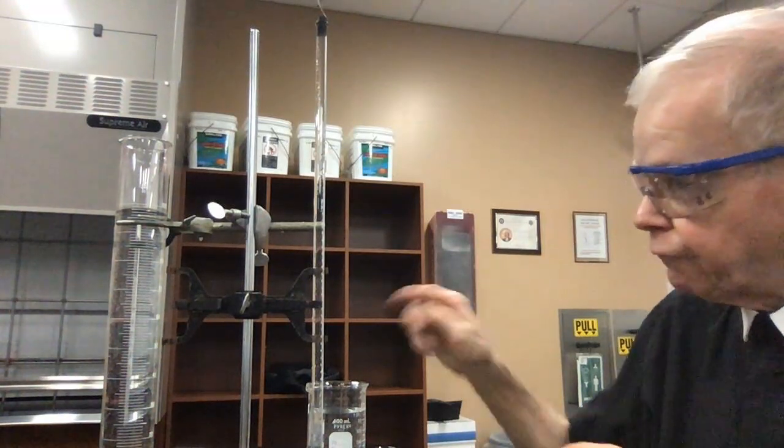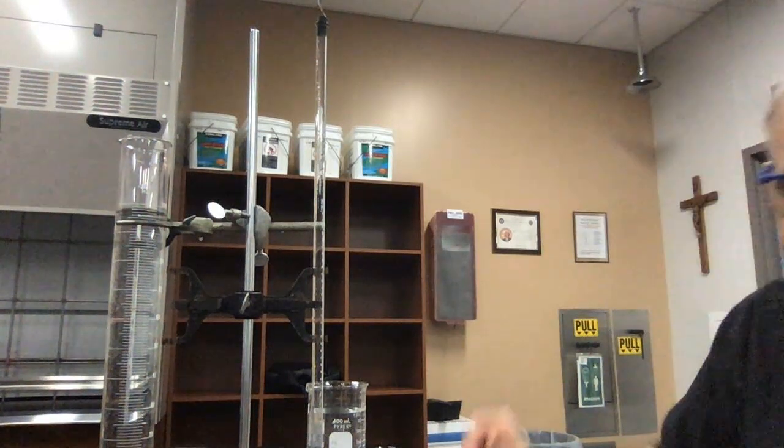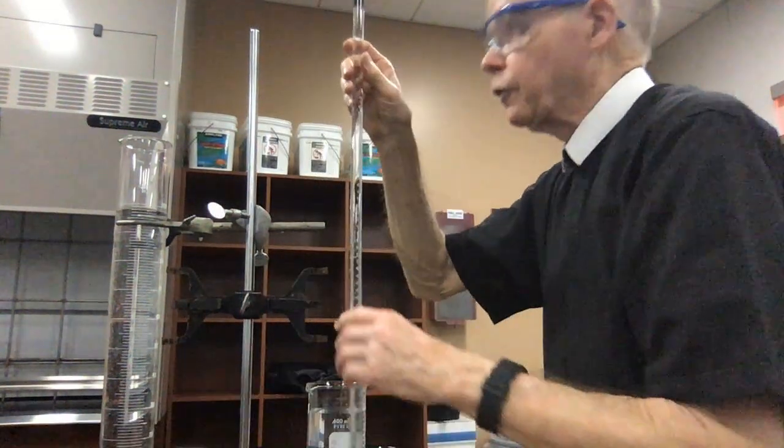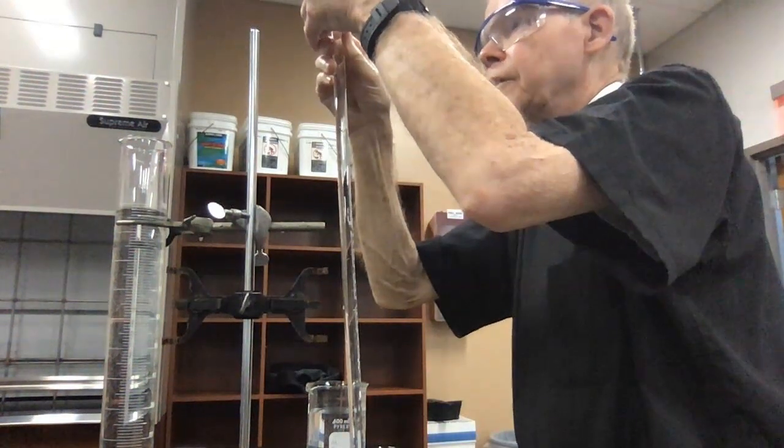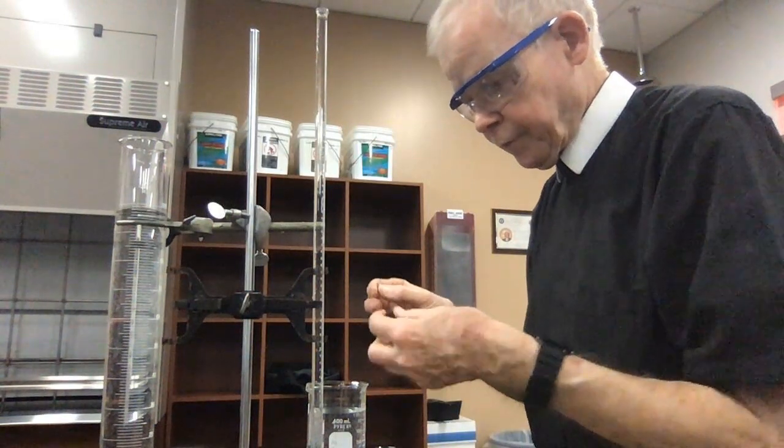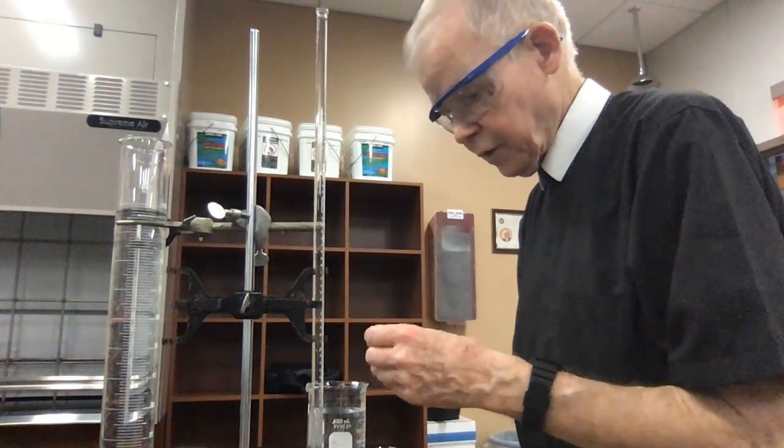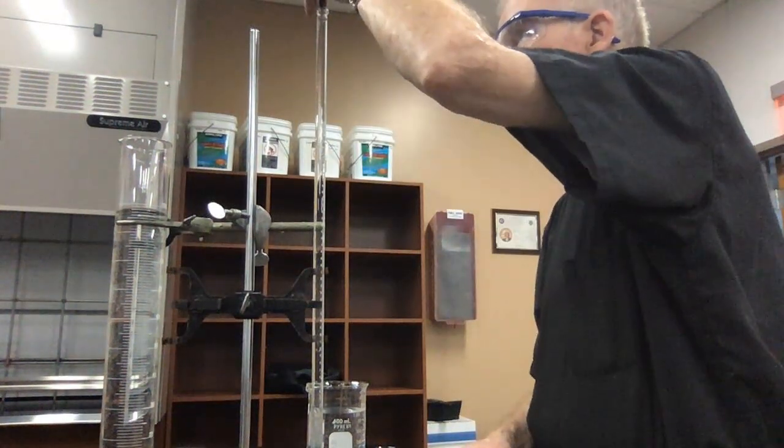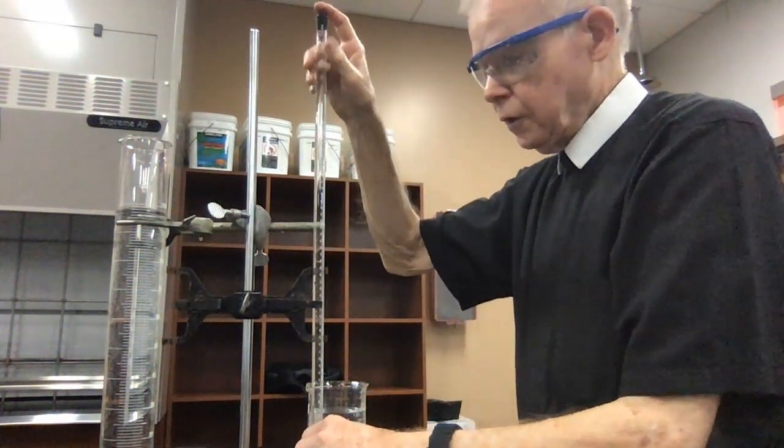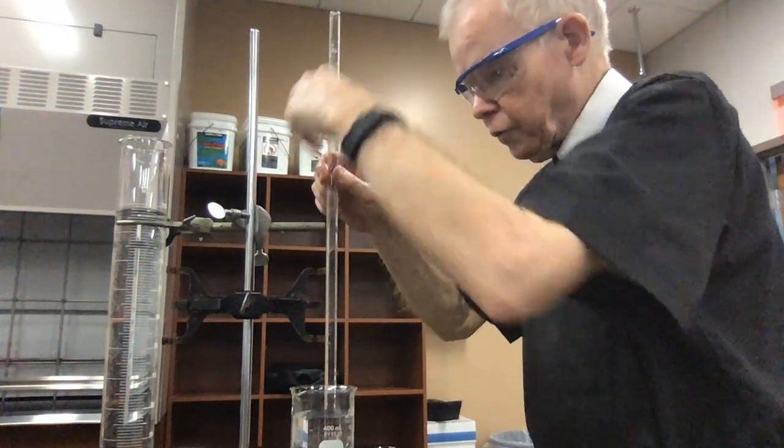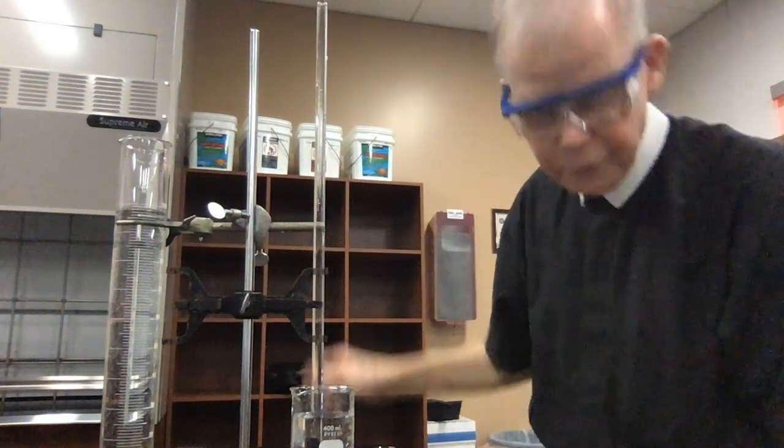Its purpose is to trap gaseous substances. So the next thing I want to do is invert it and put it down into the beaker of water. So because the bottom has got the acid in it and the top part has just water, I can take this off and flip it over, hold my finger on the end of it. I don't have to worry about the acid getting on my finger. Let me just readjust my magnesium here. I'm protected by a lot of water that's there. Okay, so there's our piece of magnesium again. We'll put that on the top, push it in all the way. A little bit of water came out. That's good. I don't want to have any air bubbles in here. And I'll flip this over, and then invert it down into the beaker, which already has the water in it.